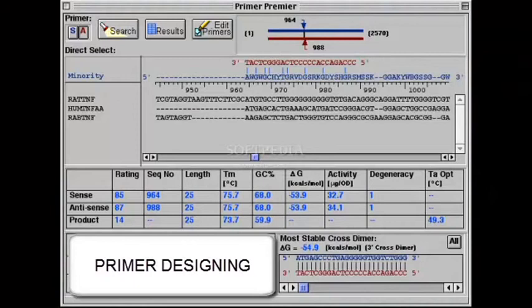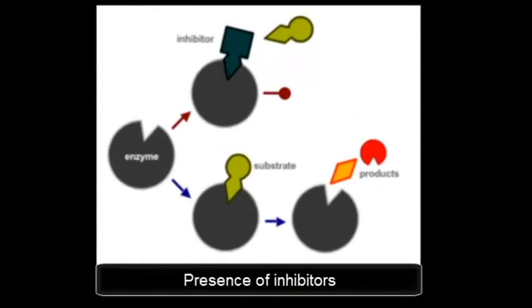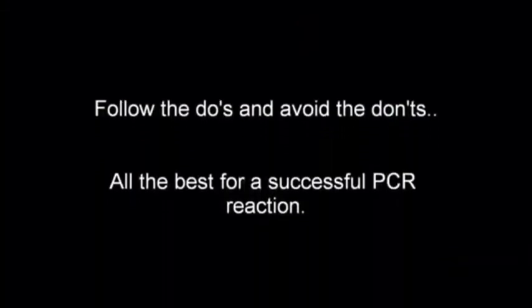Do not carry the samples in hand. Poor primer designing like self-complementary must be avoided. Inhibitors like chloroform, phenol, ethanol must be avoided. Follow the do's and avoid the don'ts. All the best for a successful PCR.